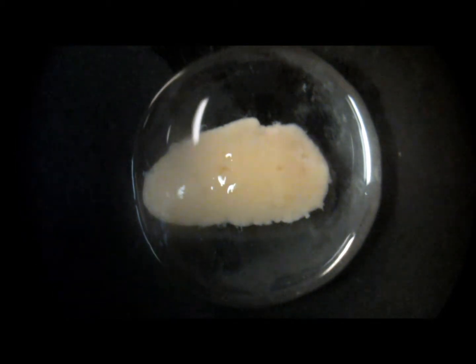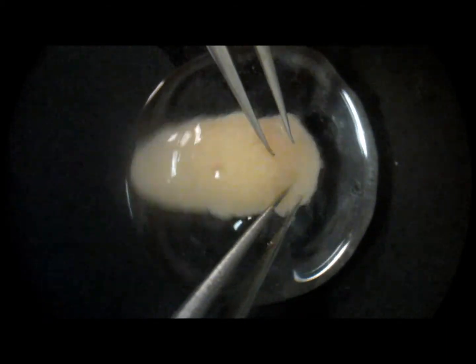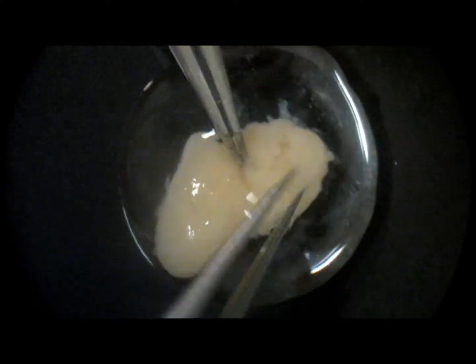After cleaning, this is what the testis should look like. Mince the testis meticulously from one side to the other using your number 5 forceps.